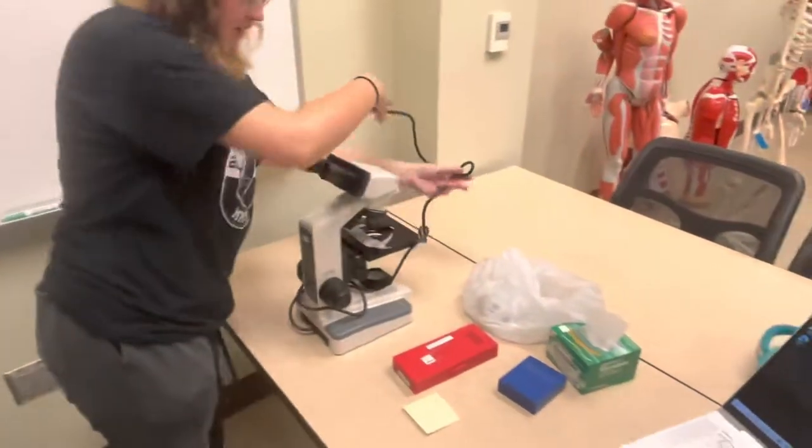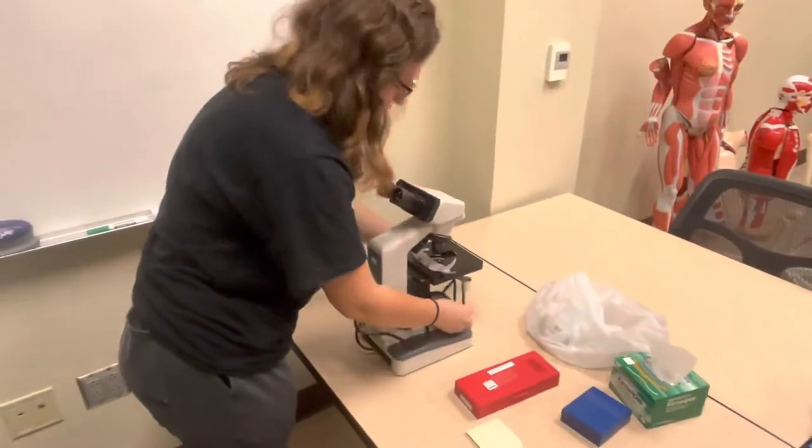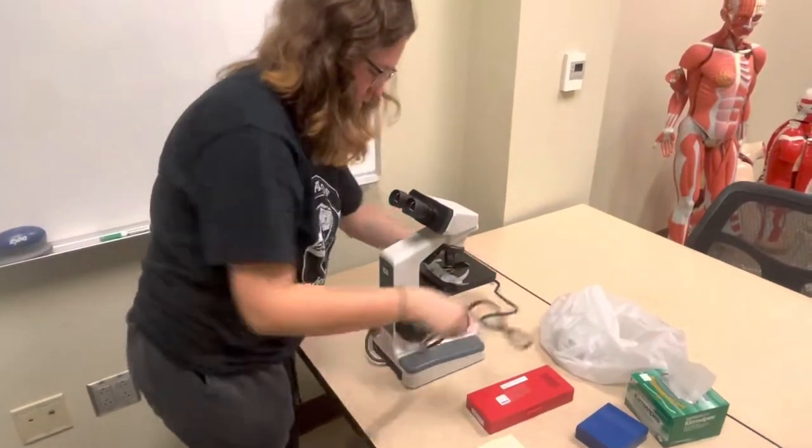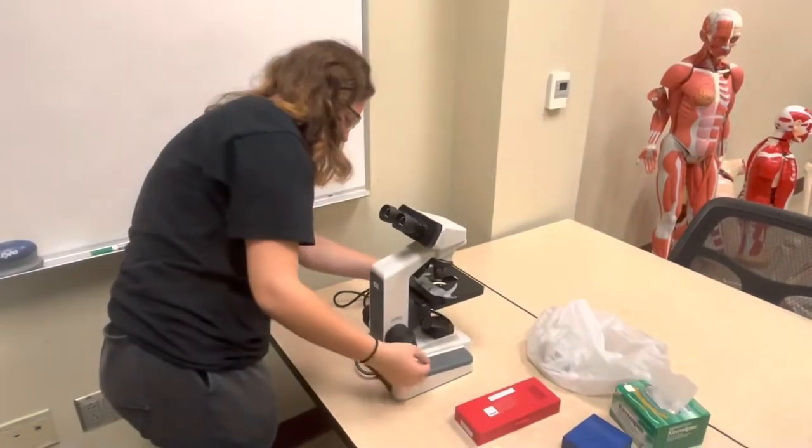You're gonna take the protective thing off. Carefully get the cord out from around the microscope. Be very careful, take your time.